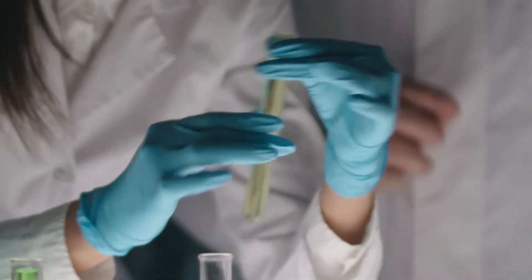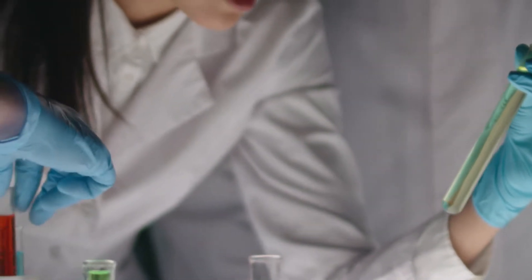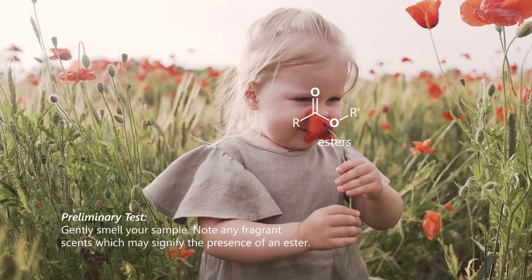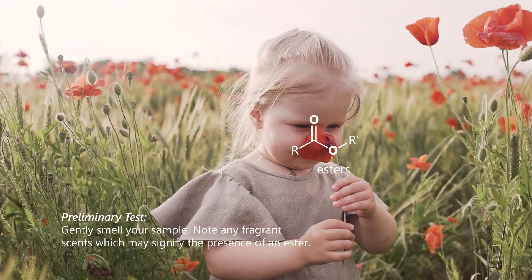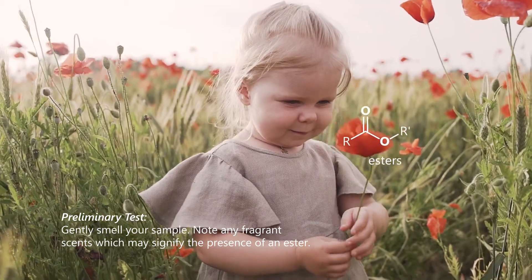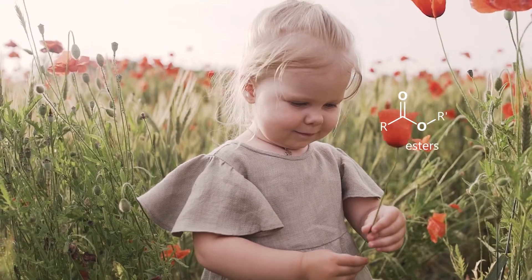Prior to testing, take a small amount of sample and gently smell it. If it smells fragrant, take note that it may already be an ester. Proceed with testing.